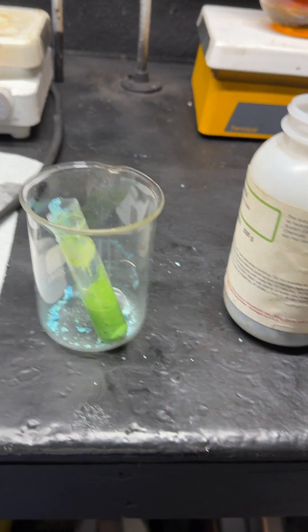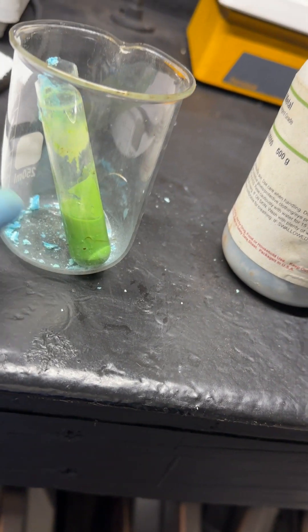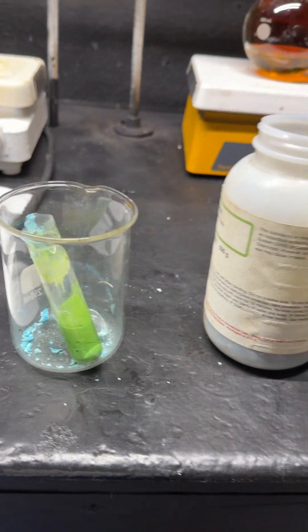So, we're first going to need an arsenic-containing material. This is our quote-unquote dead body here, but this green stuff here contains arsenic. It is Scheele's Green.